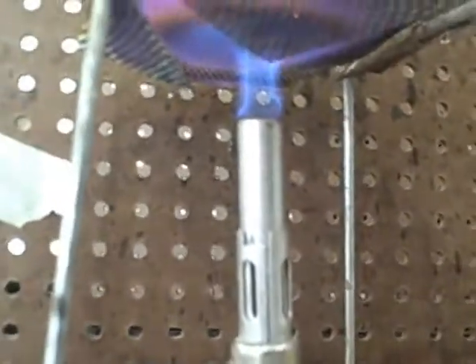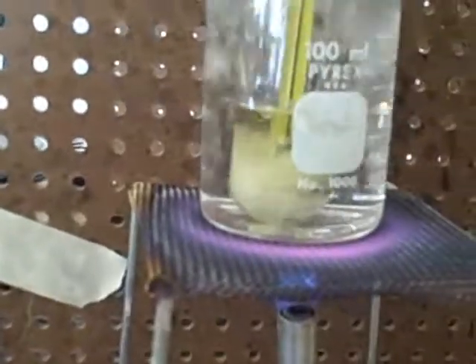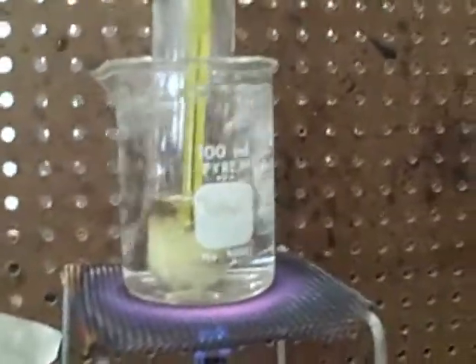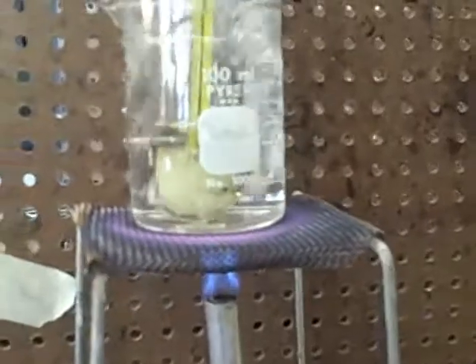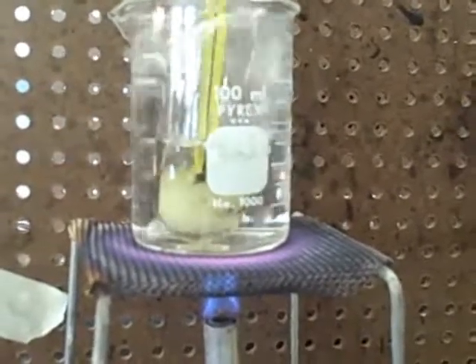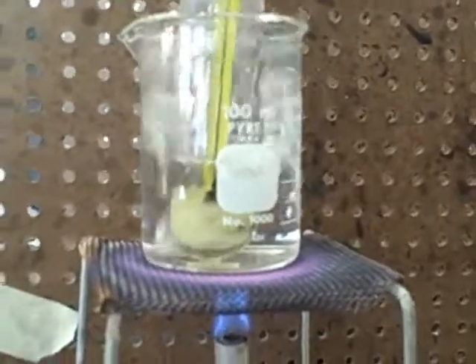See the fire? I'm gonna put them in the fire. After the liquid is completely melted... The water's boiling! After the solid completely melts, we're gonna stir it. Oh boy, we got some bubbles! Look at there — it's exploding. We'll be stirring the melted substance with the thermometer to ensure that the temperatures will be the same throughout each substance.